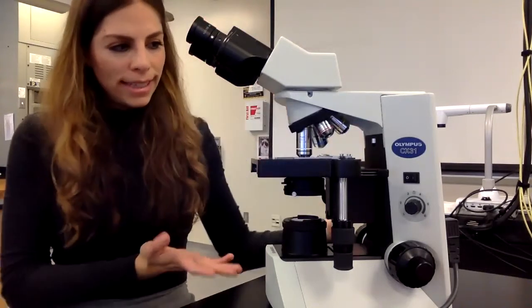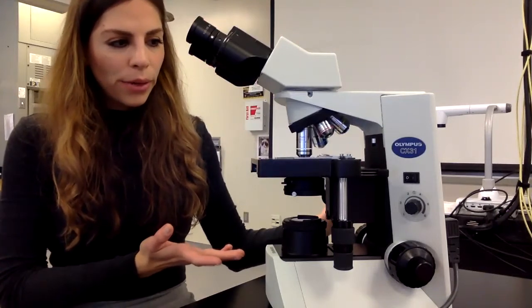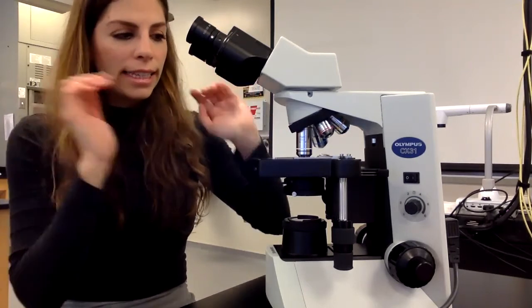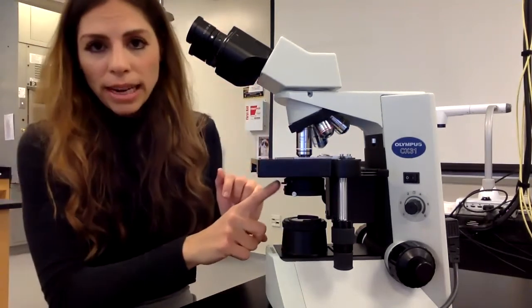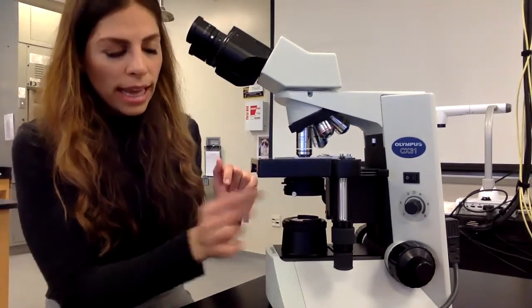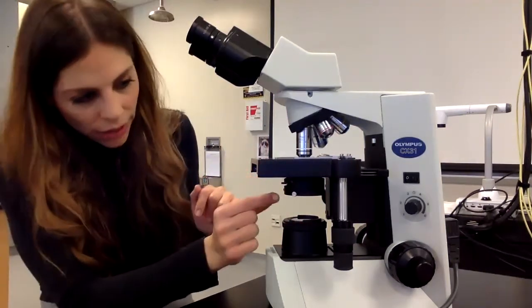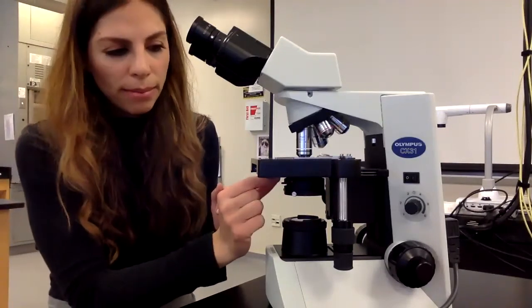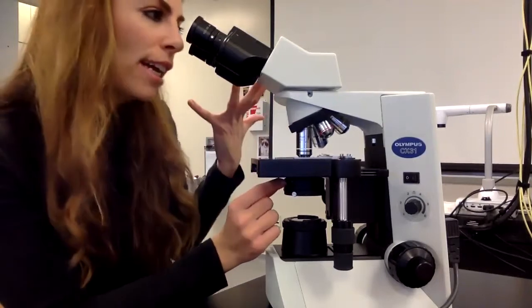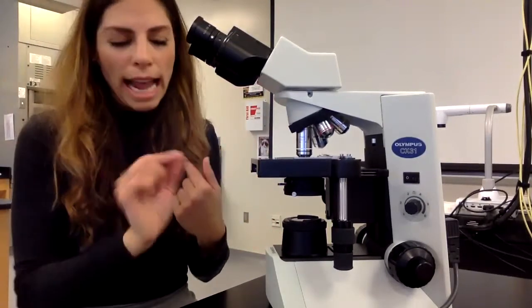And so this is our microscope that we go through. Again, these are the objective lenses. This is the ocular lens. This is the stage. This right here is the condenser. The condenser focuses light through our specimen. On the condenser, there's the iris diaphragm lever that adjusts the amount of light. So if I move it left and right, if you're looking at your slide, you can see less and more light as you move it.